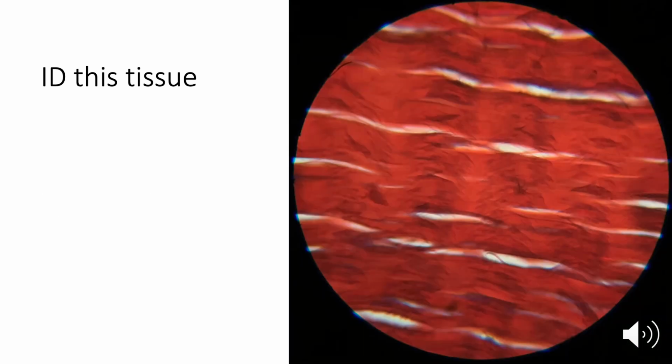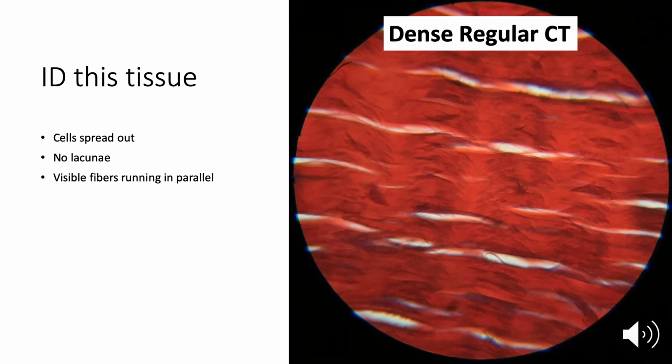Here's our next one. So what I'm looking at here is I see some lines that kind of all appear to be going in the same direction more or less. I see some nuclei, these sort of darker dots here and here and here and here, but they don't seem to be regularly spaced. My cells appear to be spread out. I don't see lacunae. Now I do see some empty white spaces, but they're not bubble-like in shape, and I don't see cells in those white spaces. So those would not be lacunae. What I do see are fibers, and these are the fibers that are running in a parallel direction. And that would tell us that this is dense, regular connective tissue.